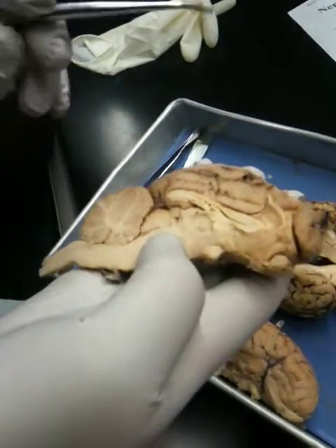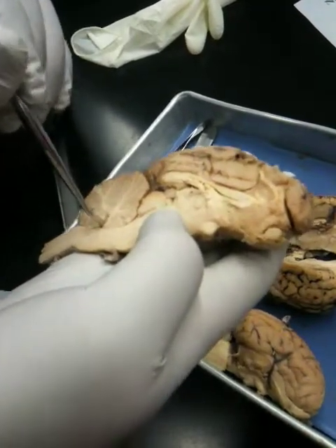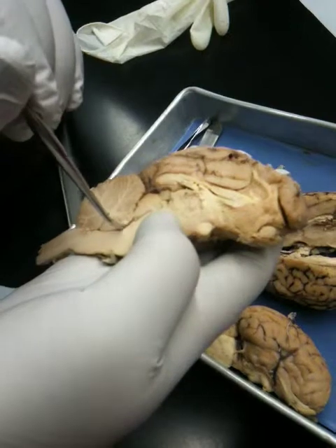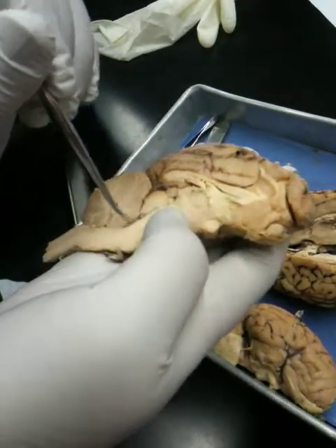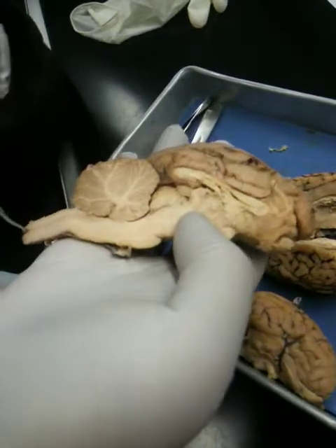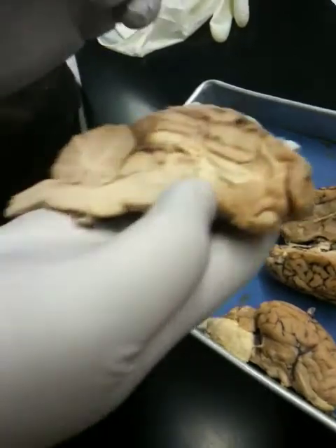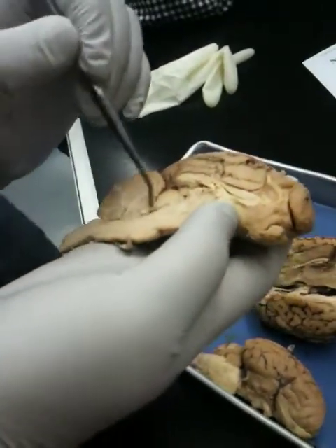This is the cerebellum, and this is the arborvitae in the cerebellum. The third and the fourth ventricles are connected through the cerebral aqueduct, and the cerebral aqueduct is continuous with the central canal. You don't need to know Sylvius — just cerebral aqueduct.